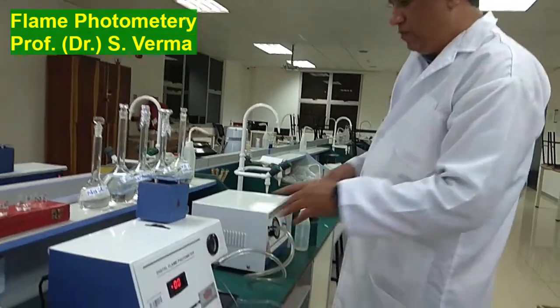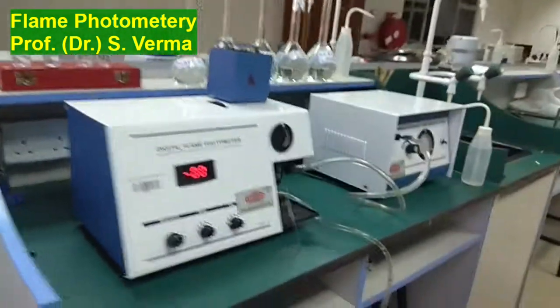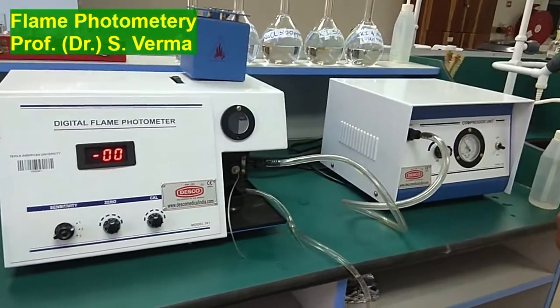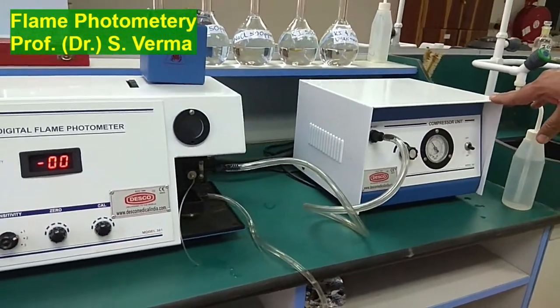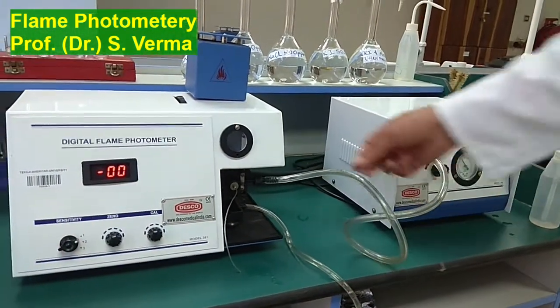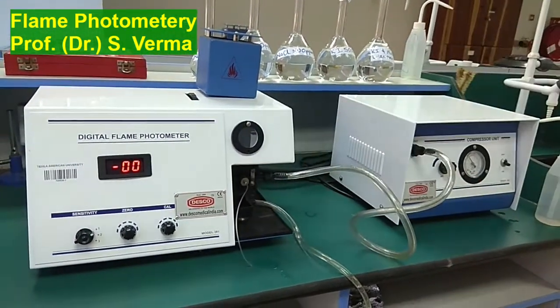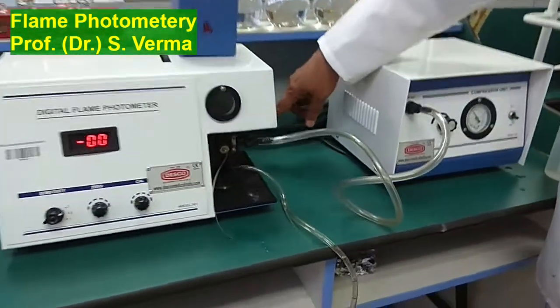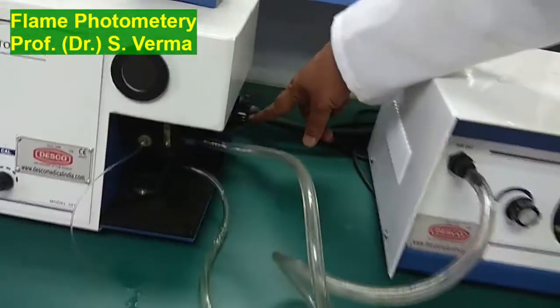So this is the instrument which we are going to use. This comes in two parts. One being the main unit, which is the flame photometer. The other is a compression unit which gives air at a particular pressure. This is being connected through this pipe to this instrument over here. Then we have a gas knob here with which we can control the gas flow.